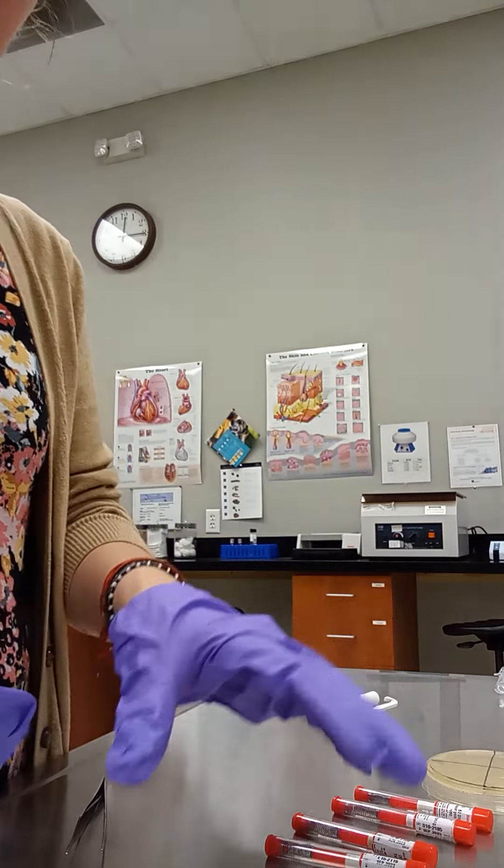These little vials do come with a fancy clicker applicator, but these can be kind of tricky to use. Today I'll be using a pair of thumb forceps to help get the paper disc off and onto my plate.